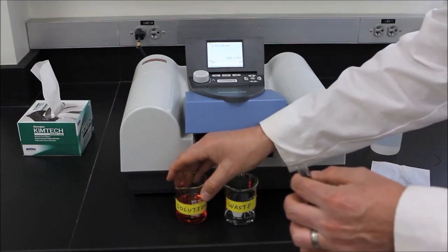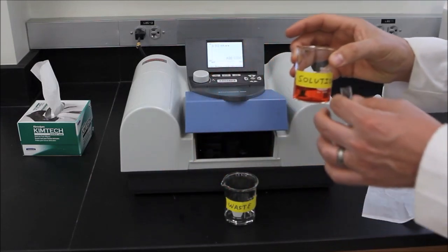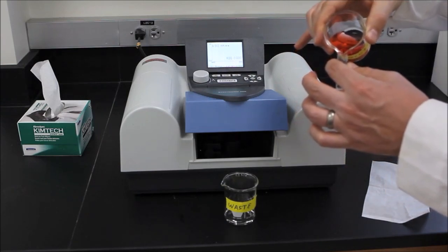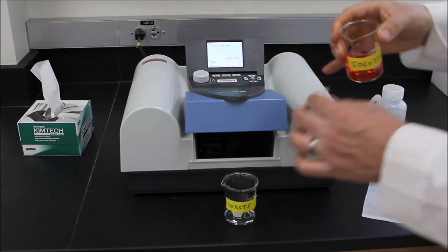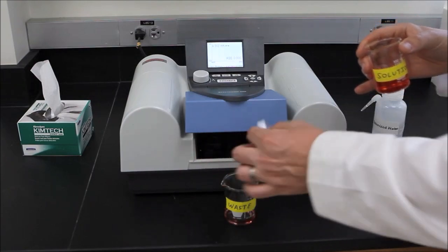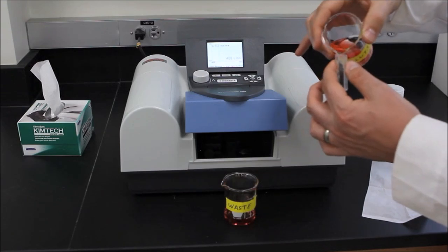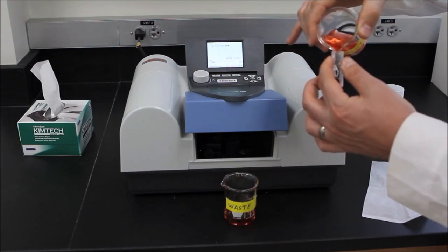Then rinse your cuvette with three small volumes of your solution. Finally, fill the cuvette at least two-thirds full with your solution.